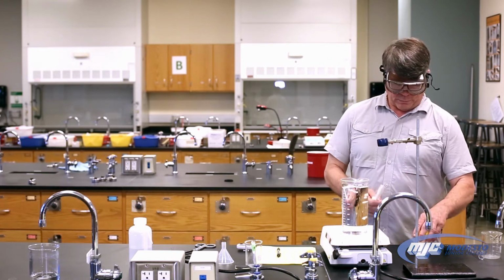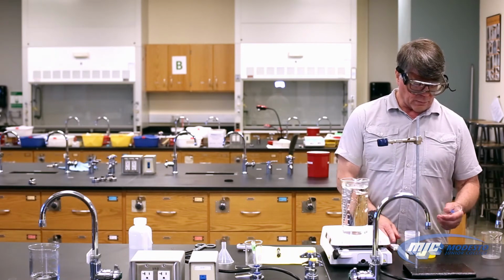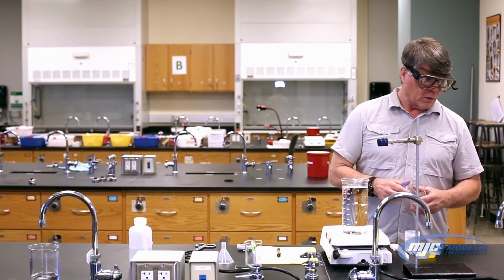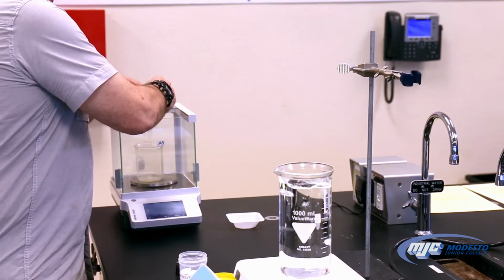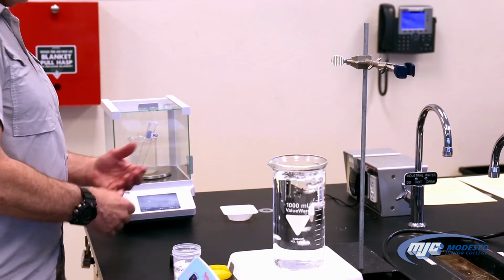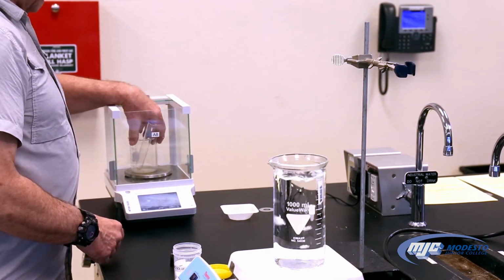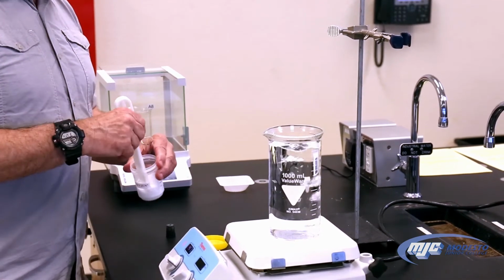So for the lauric acid, we're going to weigh out some lauric acid first. Now, we're going to use a large test tube. We don't care how much the test tube weighs. We're going to put it in a beaker. We don't care how much the beaker weighs. So we put the beaker with the empty test tube on the balance, just like before. Close the door, we tare the balance. So now the balance should say 0, with the beaker and the test tube on it. Once we do that, we take it out, so it's zeroed out, and we're going to fill this guy up pretty much all the way.